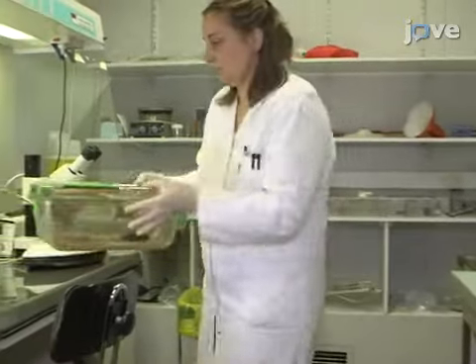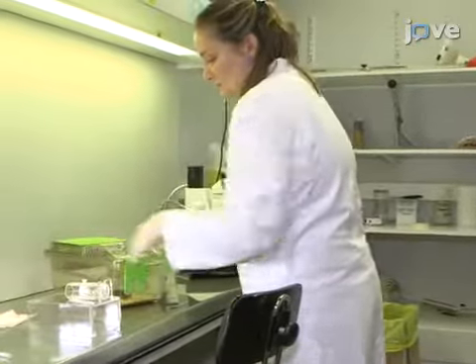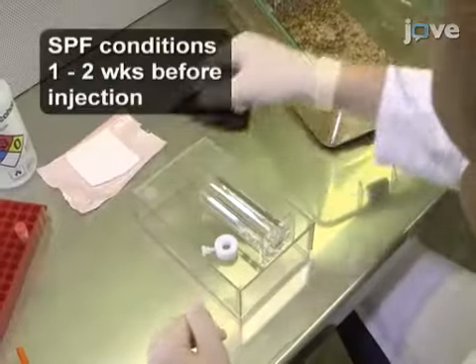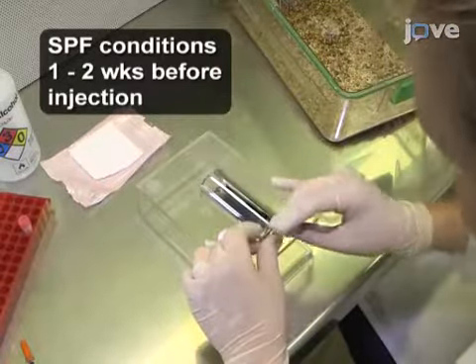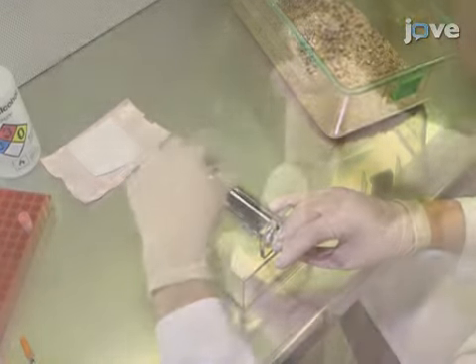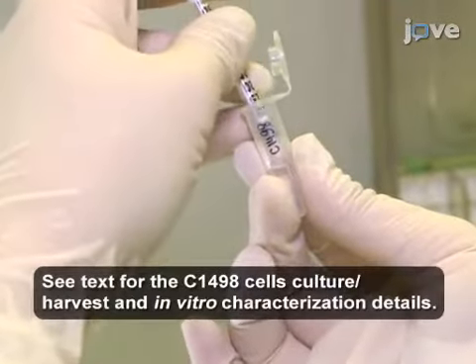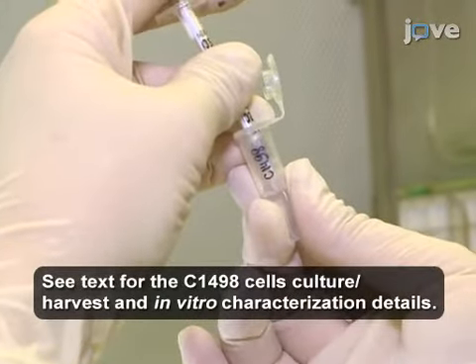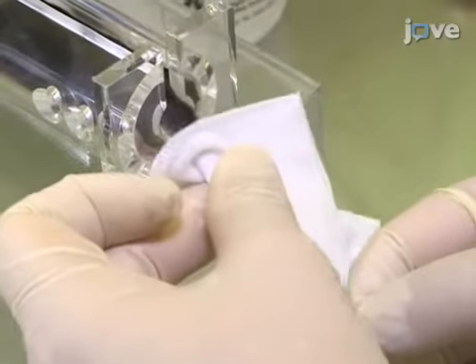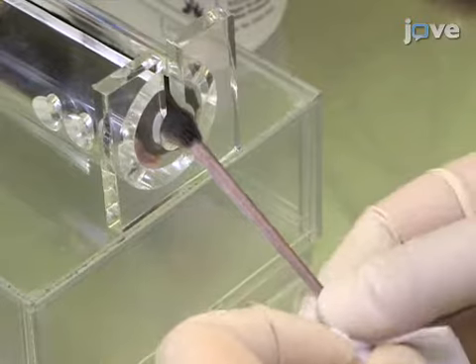Begin by transferring a 5 to 6 week old female congenic C57 Black 6 mouse into a sterile laminar flow hood. Then, place the animal in a restrainer. Next, load a 1 ml syringe equipped with a 29 gauge needle with 100 microliters of cells. Grasp the tail at the distal end and disinfect the tail skin with a 70% ethanol-soaked gauze.